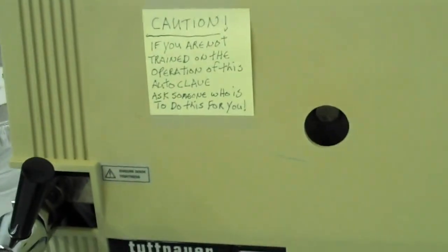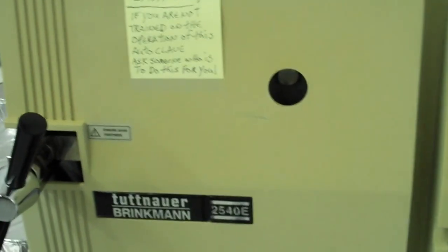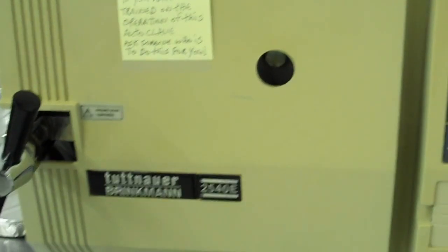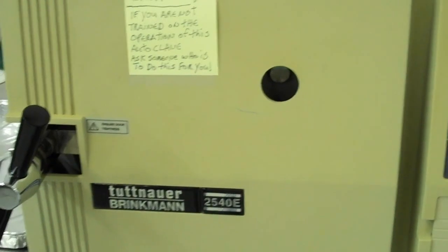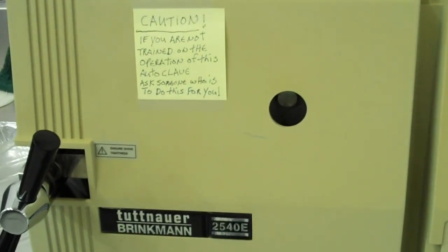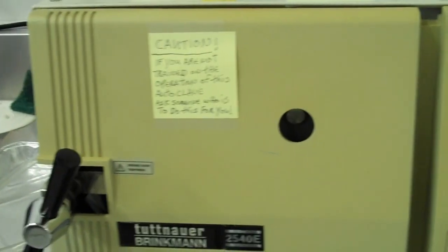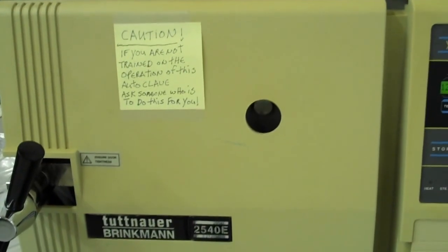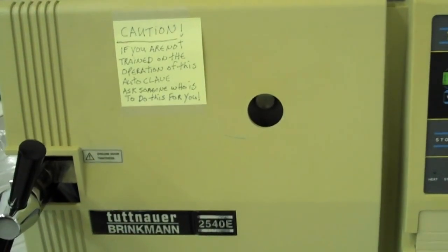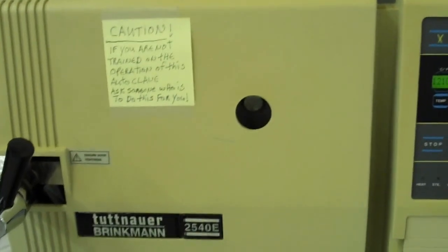Other than that, there's the maintenance part of it. You can run your cycle, then you wait for it to cool down and lower the pressure so you don't pull things out when temperature is still hot and the pressure is high. You're asking for a lot of trouble to do that.